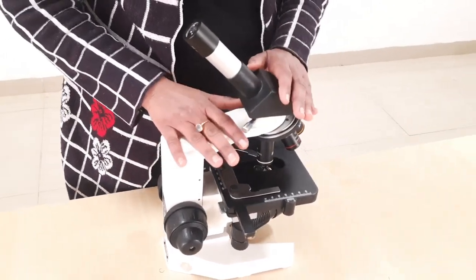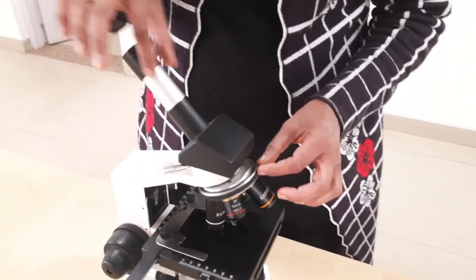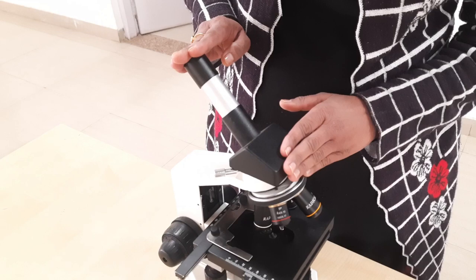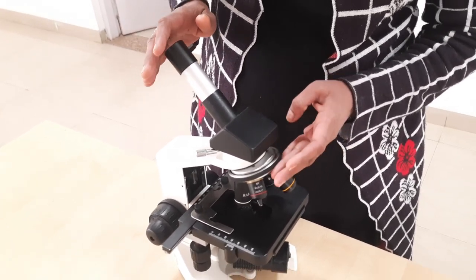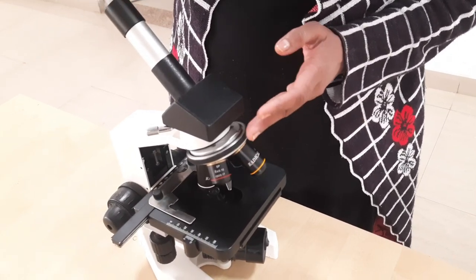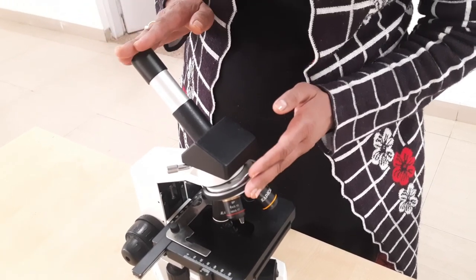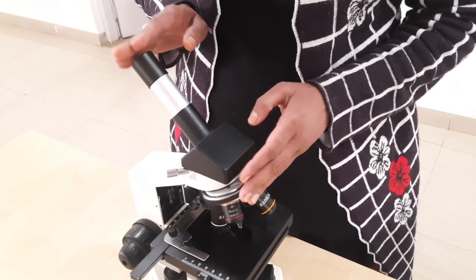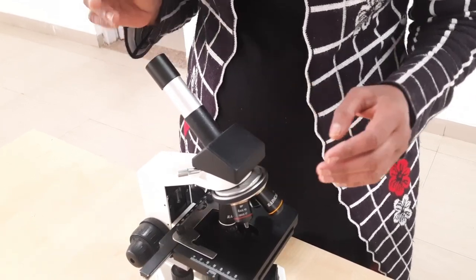There is also an optical tube — you can see it extends from the eye lens down to the upper part of the objective lens. The approximate length of this body tube is 16 to 17 centimeters.